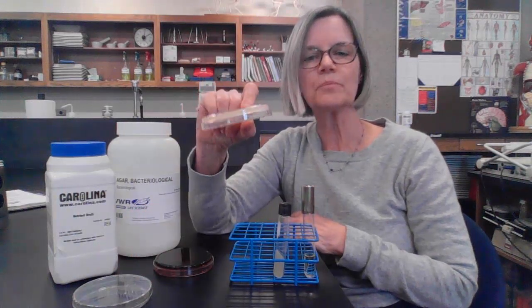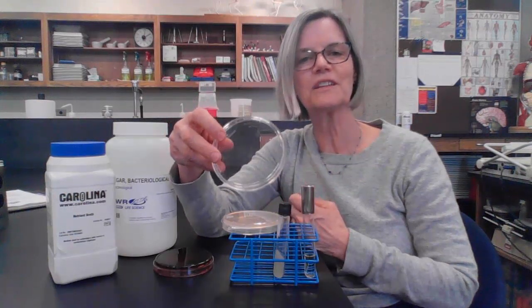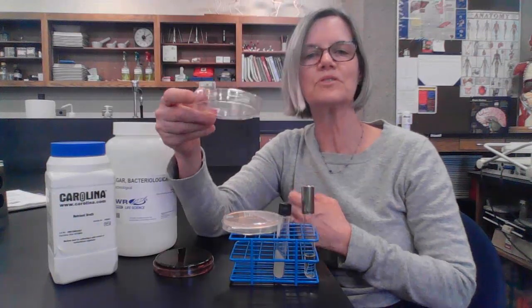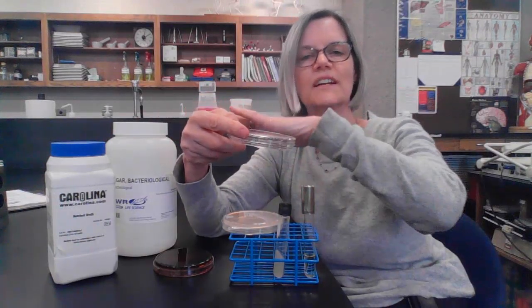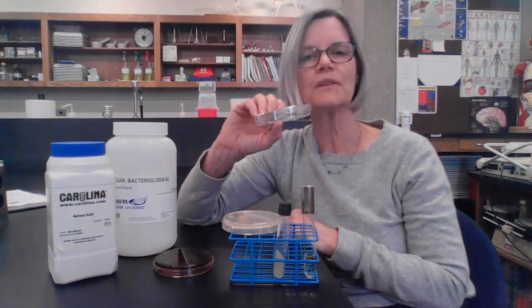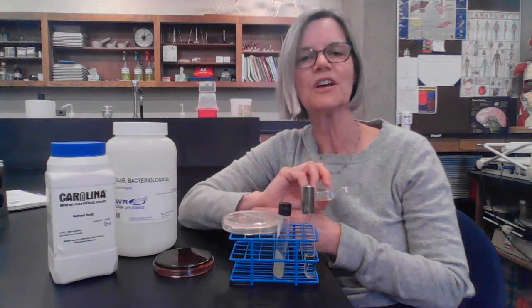The third one that I have here is what I would call an agar plate. Now, an agar plate starts off with an empty dish called a petri dish or a petri plate. A petri plate was invented by a guy named Petri in the golden age of microbiology, and it was designed to be able to spread out bacteria in order to try to separate out different kinds. So we needed more surface area.